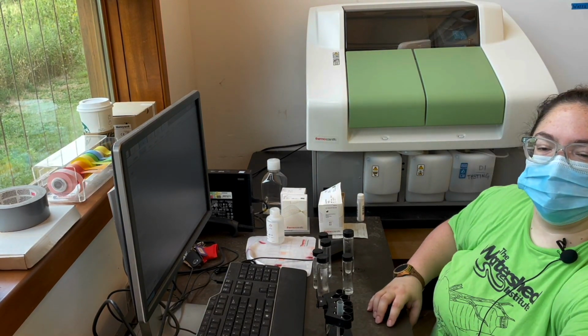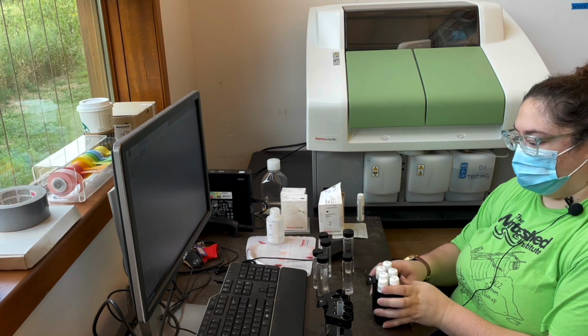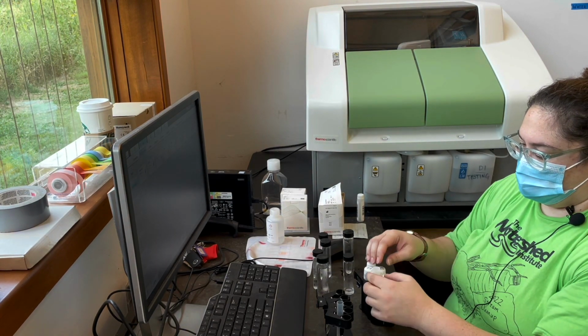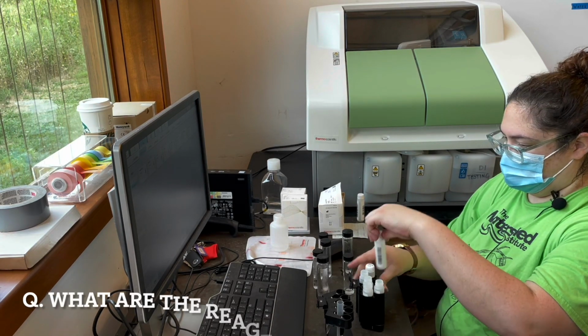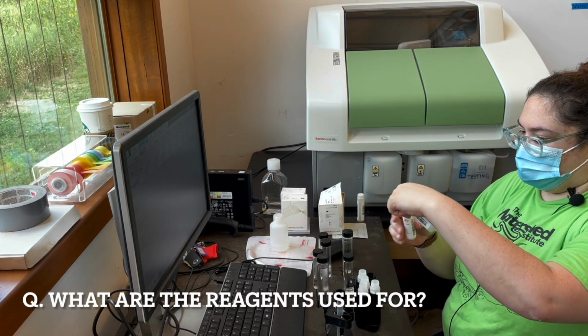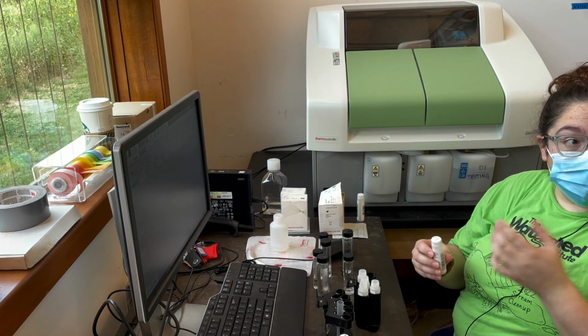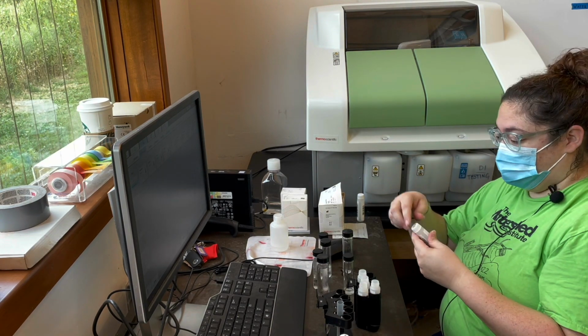Yeah, thank you. All right, so then these are the reagents that we use for the tests. What are the reagents for? So these are what react with the sample to help us tell how much nutrients are in them.